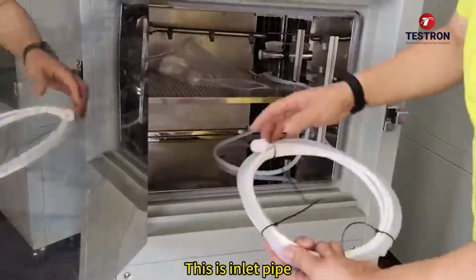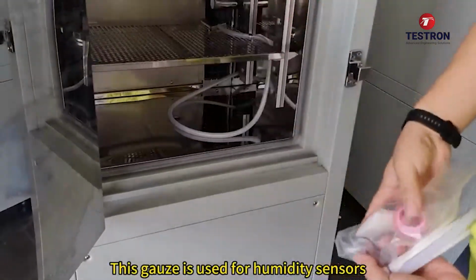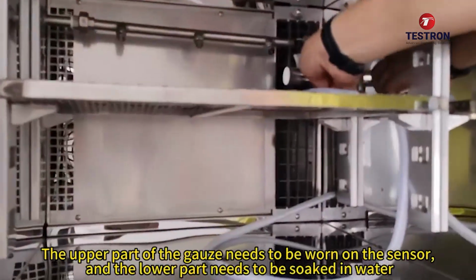This is the inlet pipe. This gauze is used for humidity sensors. The upper part of the gauze needs to be worn on the sensor, and the lower part needs to be soaked in water.